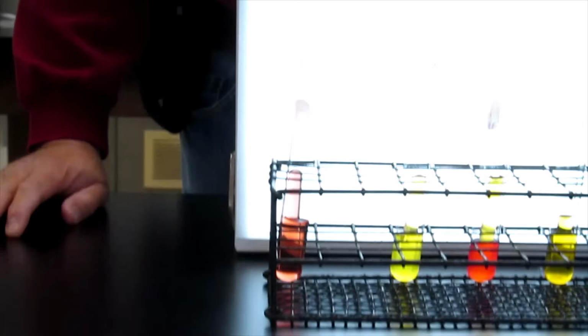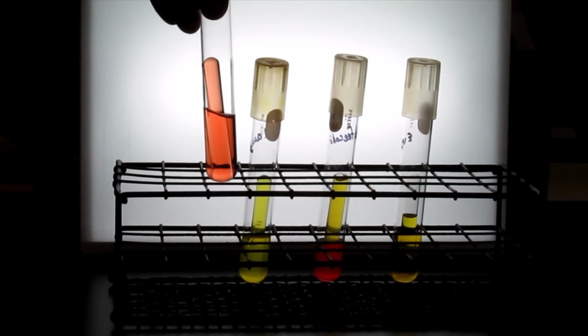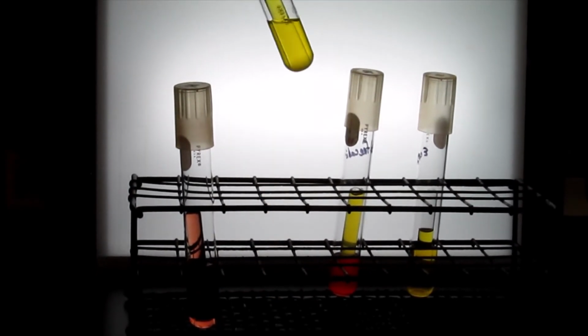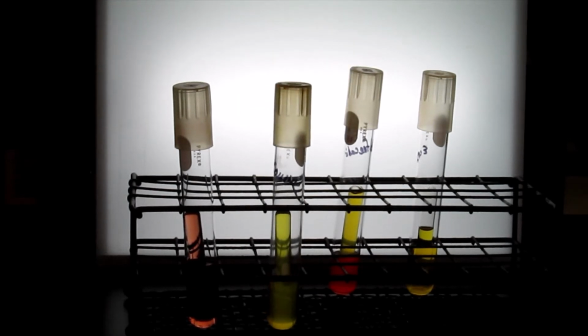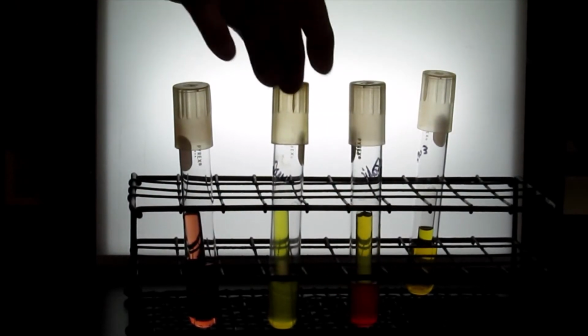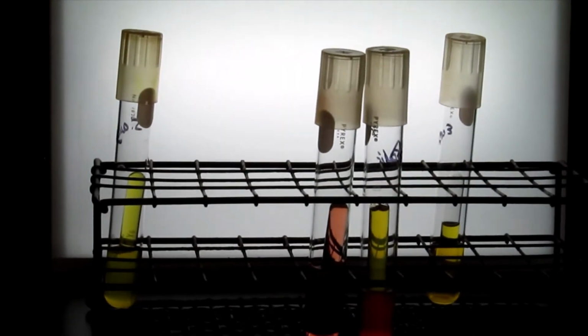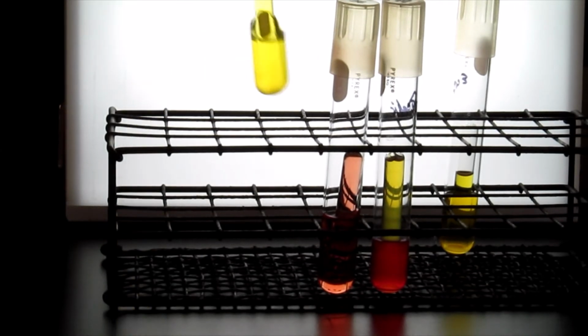And what we have are some examples of the color change that you might see from the starting red color. If you produce acid during the digestion of your sugar, in the case of lactose, you can get the formation of protons that will change the pH indicator, the phenol red, to a yellow color. If, on the other hand, you produce a base, you can get a color change that will become more of a hot pink or fuchsia colored relative to your starting red color. So that's an indication of a basic pH change compared to your acidic pH change, which would be yellow.